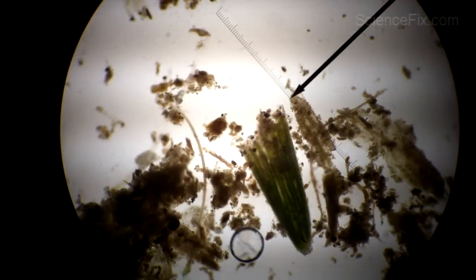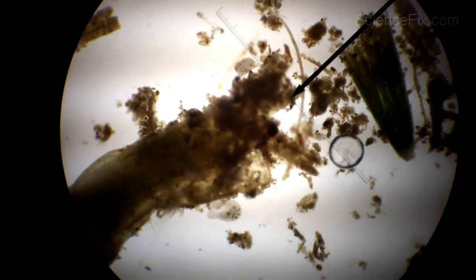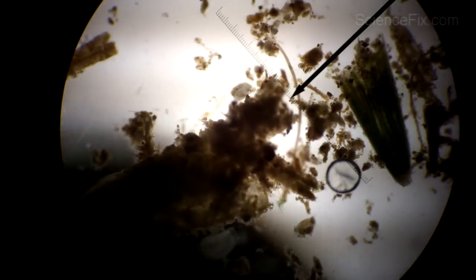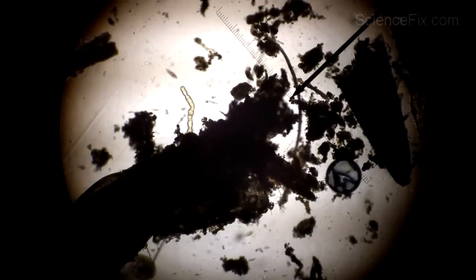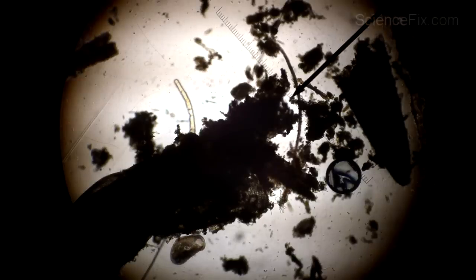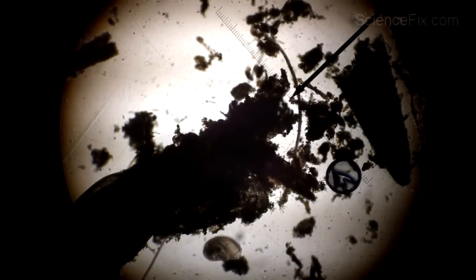This might be a good activity to do after your students have experienced and practiced with the microscope — such basic skills as changing powers, being able to move a slide one direction and notice which way it appears through the eyepiece, how to use the diaphragm to change the light, since you want lower light at certain magnifications and higher light at others, and also just being able to focus with the correct adjustment knob.